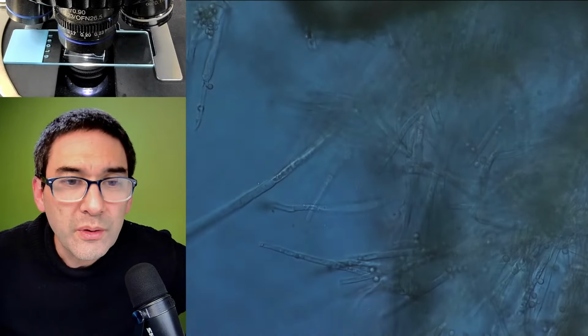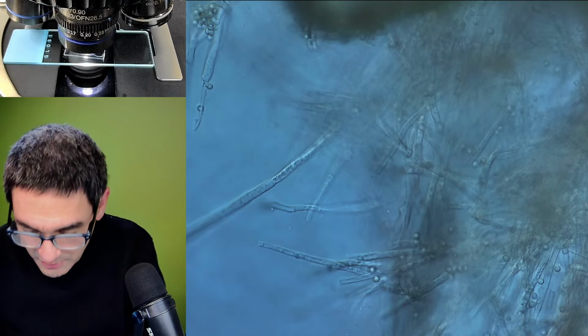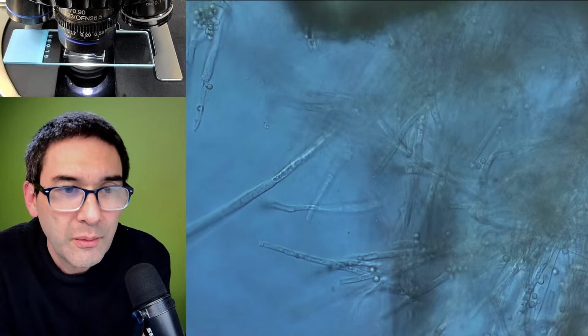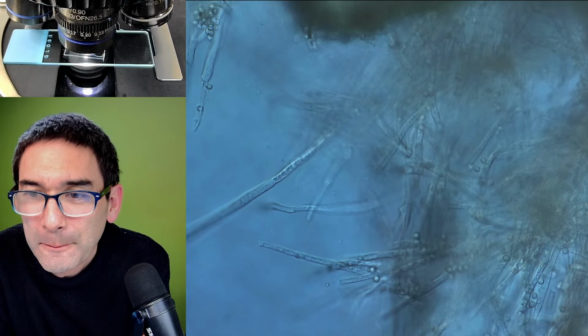And yet more, 60 times. And so just wanted to show this to you as well. And now that we have looked at it, I'm able to throw it out. I'm going to quickly read some of the questions here.